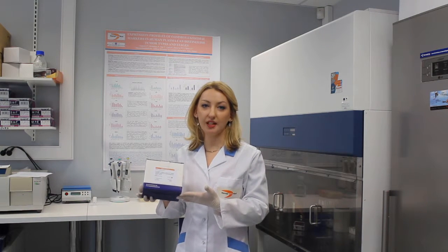Hello! I am going to show you how to use ExoTest, the most effective test for capturing and quantifying exosomes from biological samples.